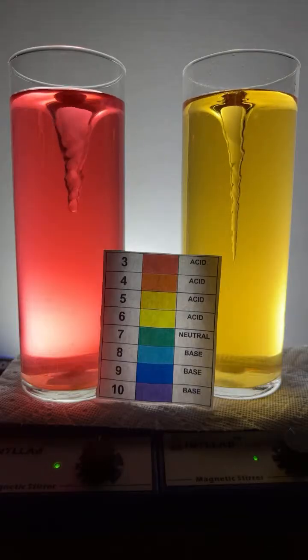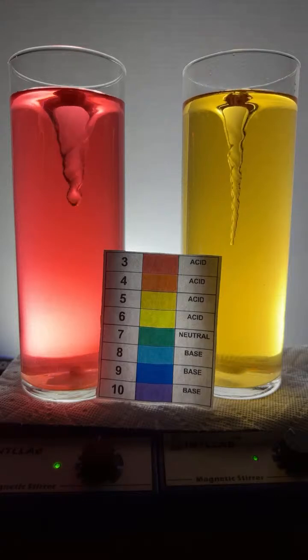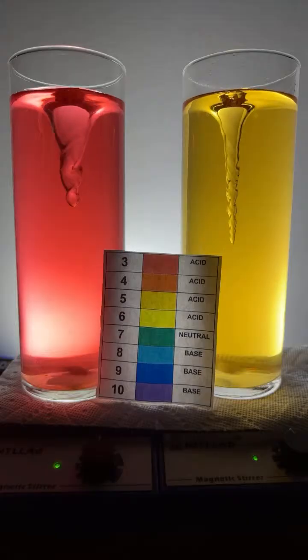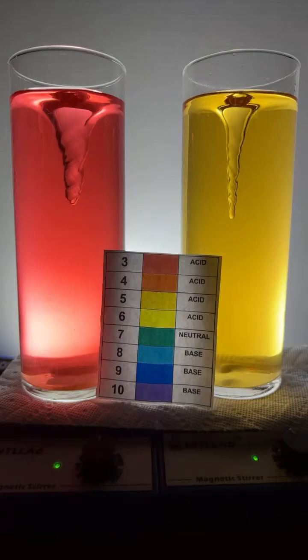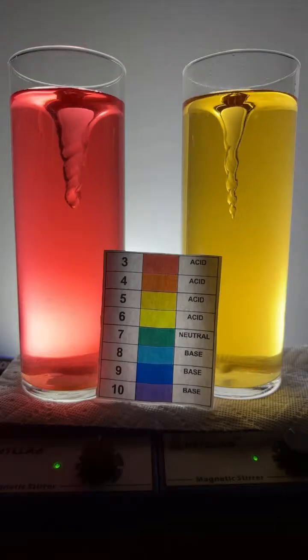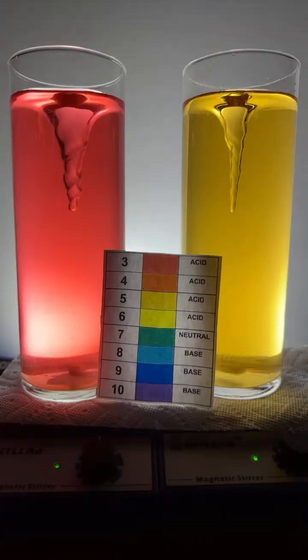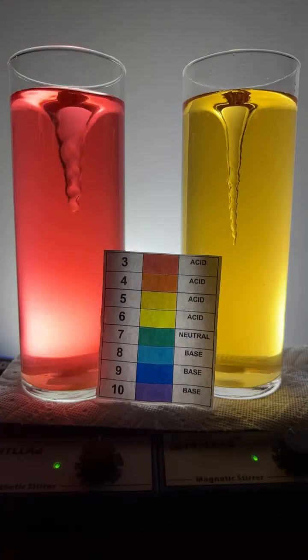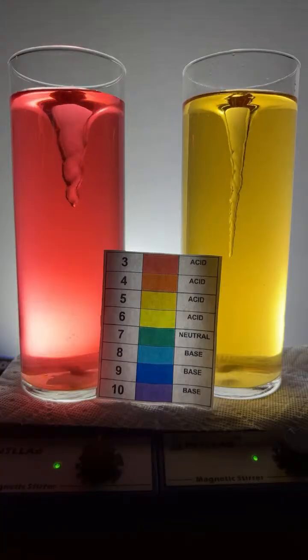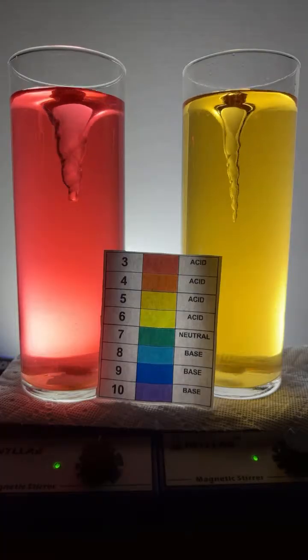So Fitter also learned from a chemical game and some videos that if you combine concentrated sulfuric acid and a bunch of hydrogen peroxide, it makes piranha solution. Fidro, check out my short videos. I've got a video where I make piranha solution. I don't show you the process of making it, but indeed I use it, and I use it to destroy a Scrub Daddy sponge. How do you like that kind of thing? All right, let's get going here, man.